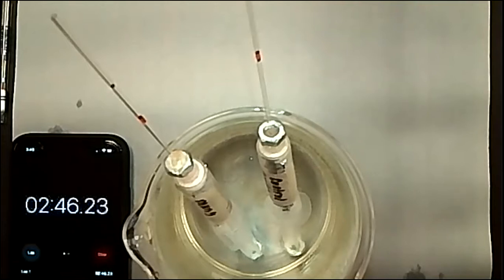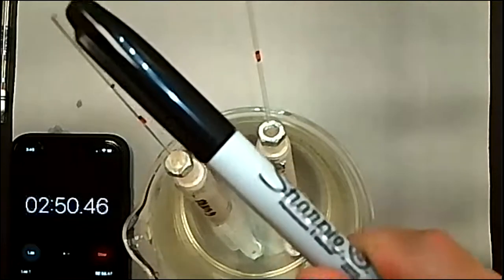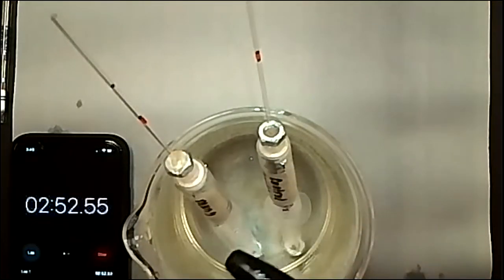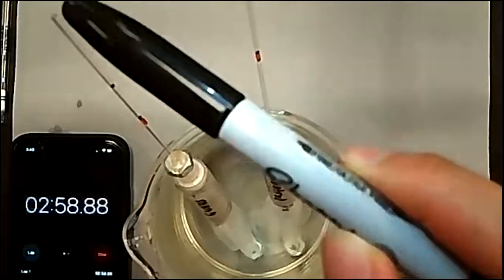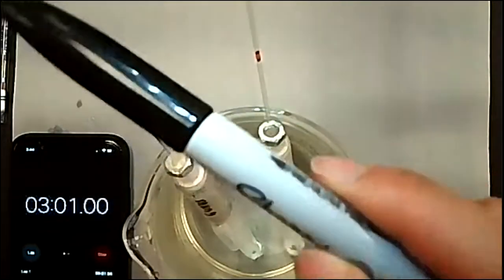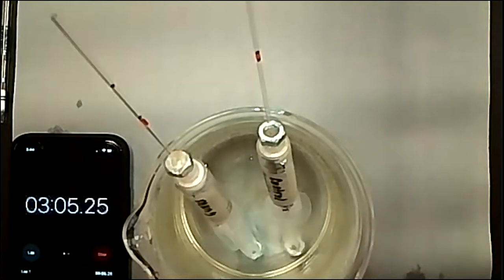And so again, I need to keep reiterating that this change in the volume right here is because once I added the manometer fluid, this became a sealed chamber, right? The bottom is sealed off by the rubber in the syringe, and the top used to be open like this as a tube, but once I put in the manometer fluid, it actually sealed off this opening. So any change now is evidence of a gas being used up.